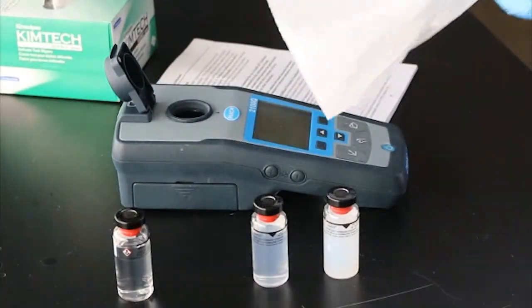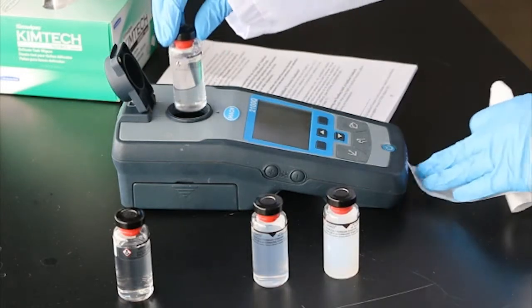If the instrument was recently calibrated, an operator can verify the calibration using standards.